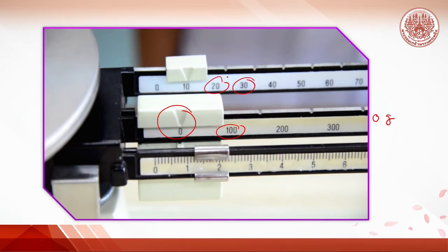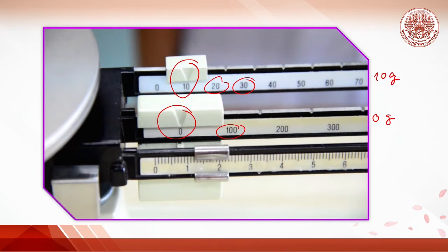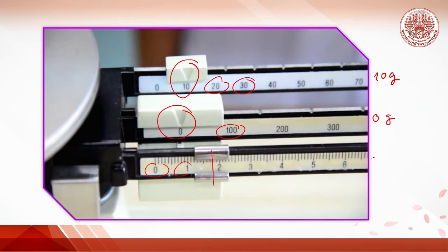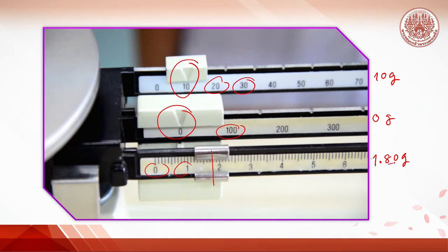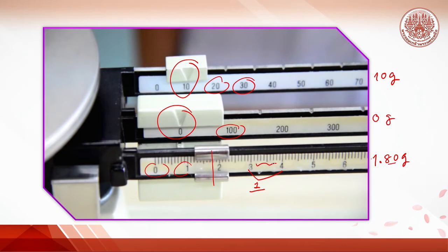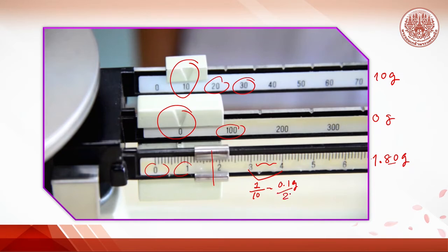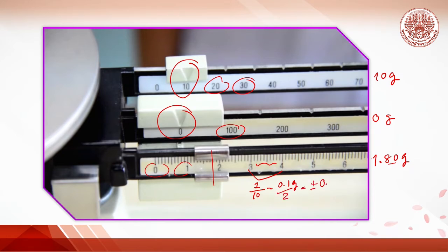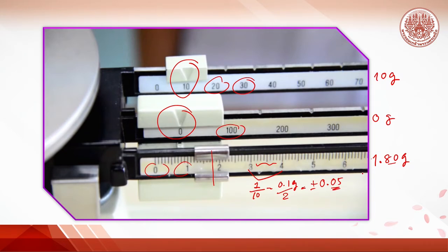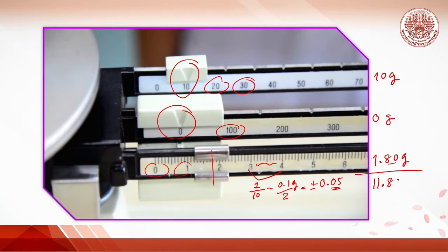The 10-gram weight is at 10, meaning the cube weighs about 10 grams. The 1-gram weight is at 1.80 grams, reported with two decimal places. This is because the scale here is 1 divided by 10 parts, which is 0.1 grams, and the absolute error is divided by 2, giving 0.05. So you report with two decimal places, and the weight of the cube is 11.80 grams.